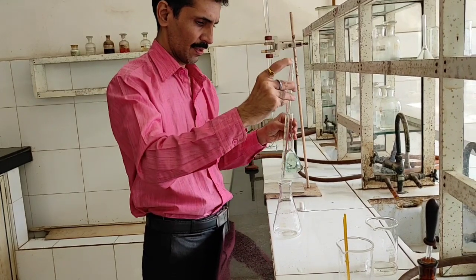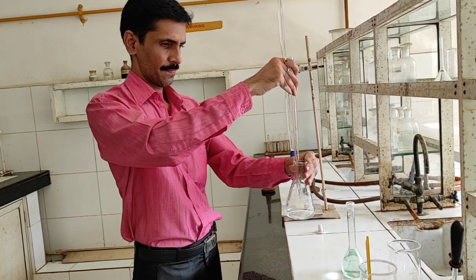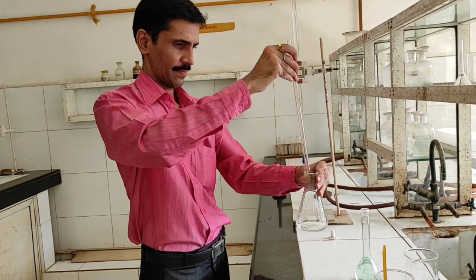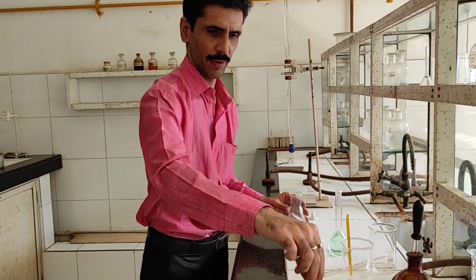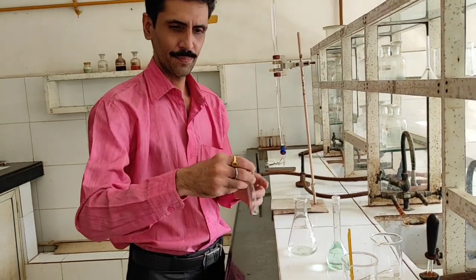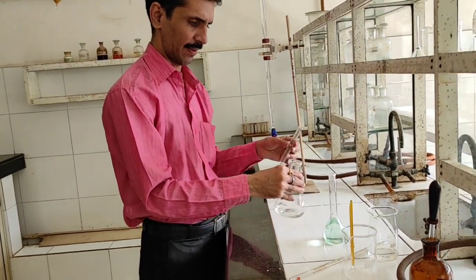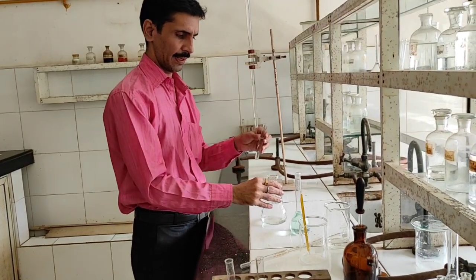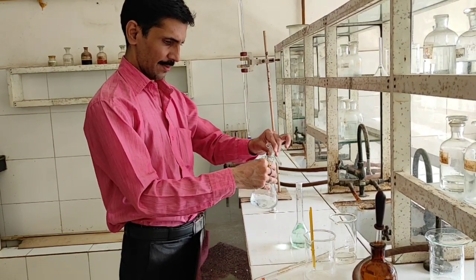So this is the 10 ml of the solution which I am going to transfer into the conical flask. Just tap it. Next, we are going to add some amount of water into this, so that the color change becomes much more apparent. Next is half a test tube of ammonium chloride. I already told you in my explanation that the reaction takes place in a basic medium. So we are using ammonium chloride and ammonia so that it behaves as a buffer and also creates a basic medium. So slowly we are going to add ammonia.